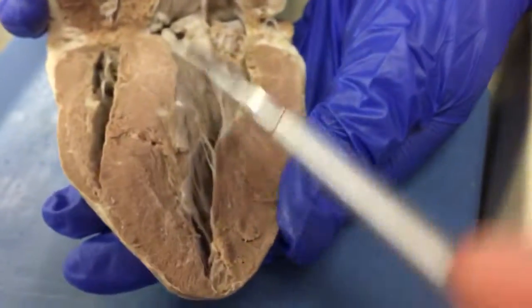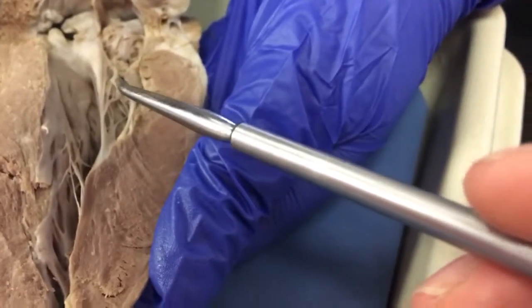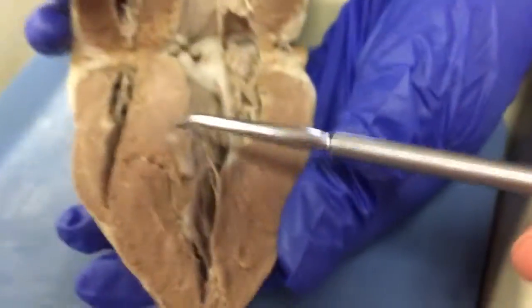Collagen. Yes, and the chordae tendineae consist mostly of collagen fibers when they pull. And then, okay, and then in a fetal heart. Yeah. You want to start? Yeah, I'll just identify it.